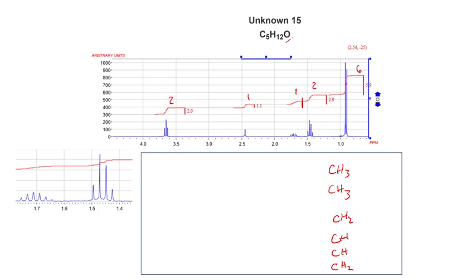Well, we have this oxygen, and if I had infrared data, I would probably be going straight to the infrared data to find out if I have an OH, because that could have been a critical piece here. And in fact, this rather nondescript peak around 2.5 is a good candidate for that. So what I'm going to do is change one of these CHs, CH to an OH. And now I have all the atoms. This is the entire structure. There are no other atoms. The objective is to connect them.